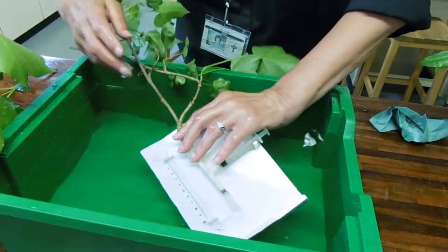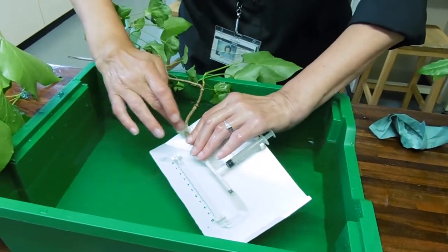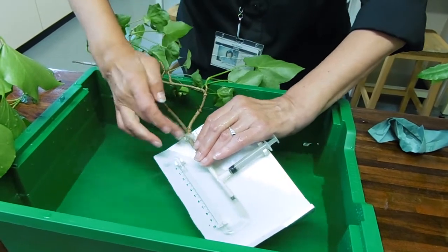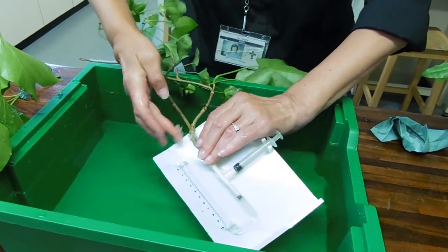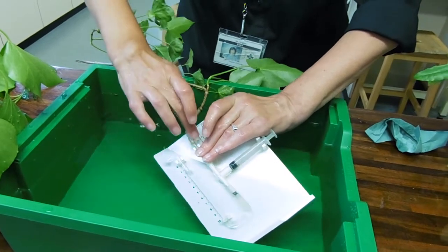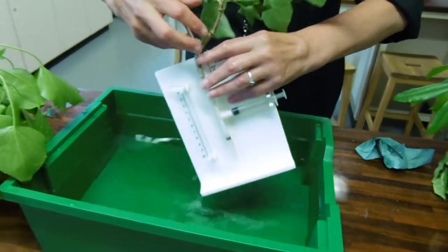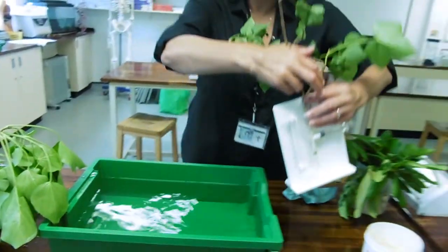As soon as I take it out I'm just going to Vaseline around the stem, just to make sure that water doesn't evaporate from that bit that's open. So there we have our set up.